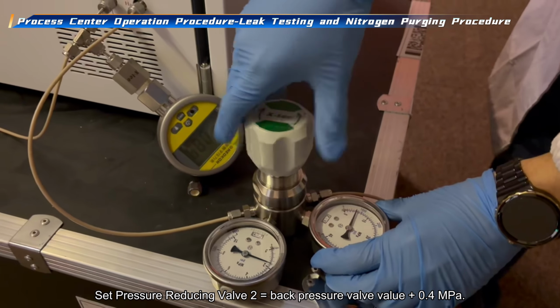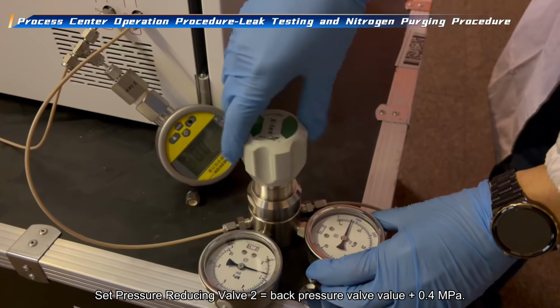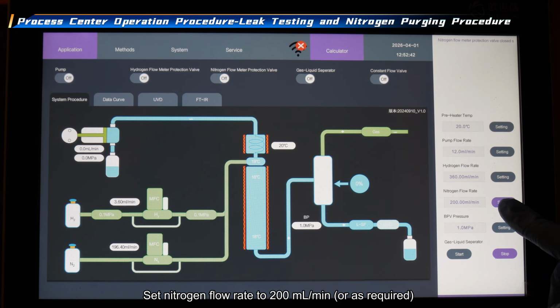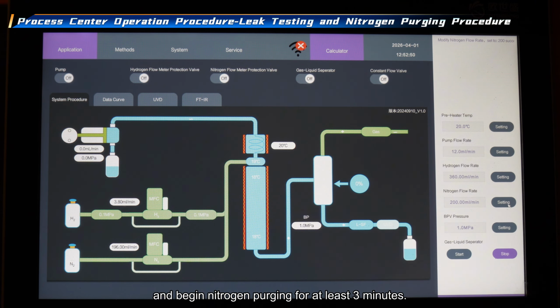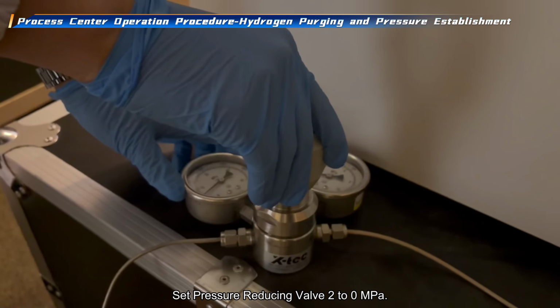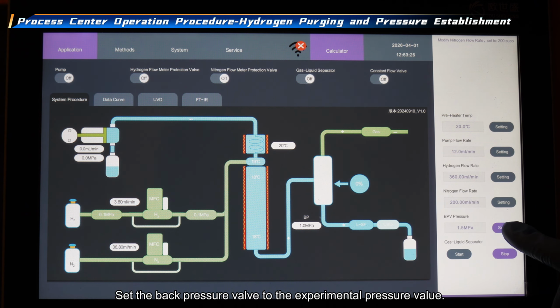Set pressure reducing valve 2 equal to the back pressure valve value plus 0.4 megapascal. Set nitrogen flow rate to 200 milliliters per minute or as required, and begin nitrogen purging for at least 3 minutes. Set pressure reducing valve 2 to 0 megapascal. Set the back pressure valve to the experimental pressure value.